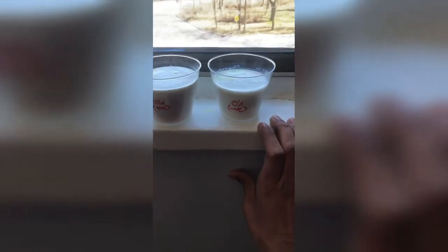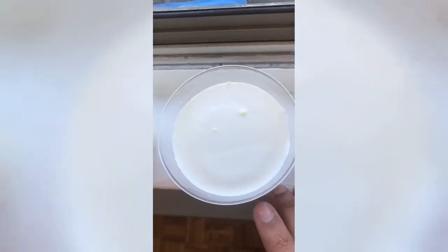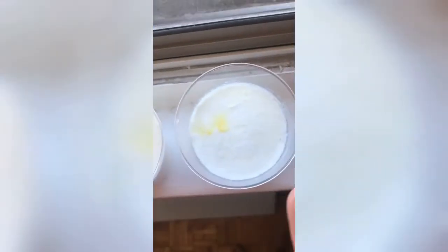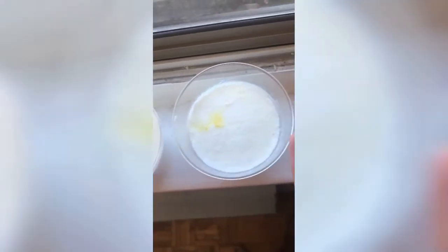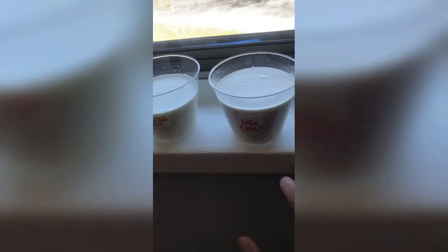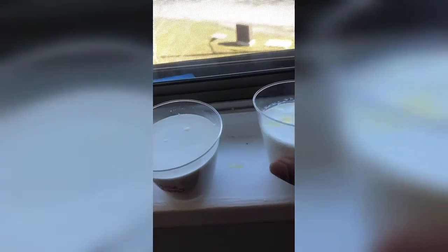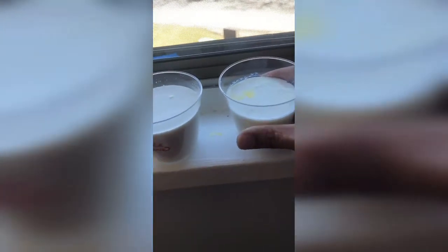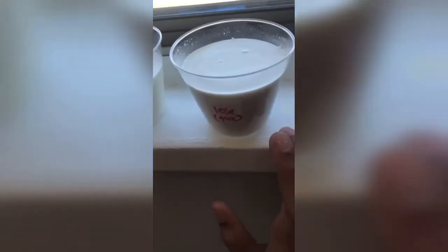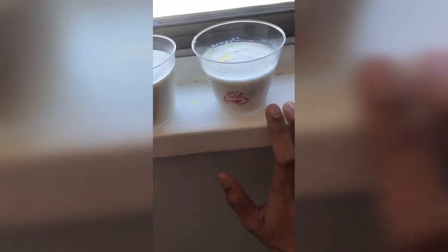Here first we talk about the texture. We can see the texture of the positive control is very smooth and very clear, and it's viscous. The negative is watery and not as even compared to the positive one. The 10% is more viscous compared to this one, as it is very watery. If I talk about the flavor, the positive control has a sweet and sour flavor, whereas the negative has a mild flavor.